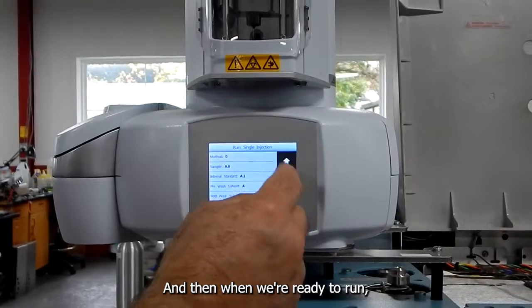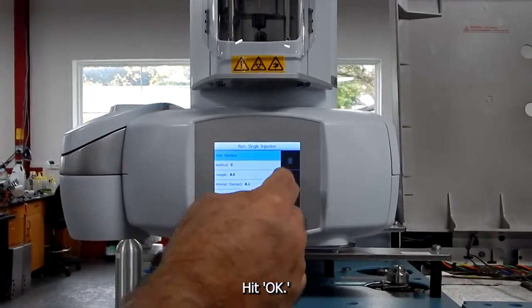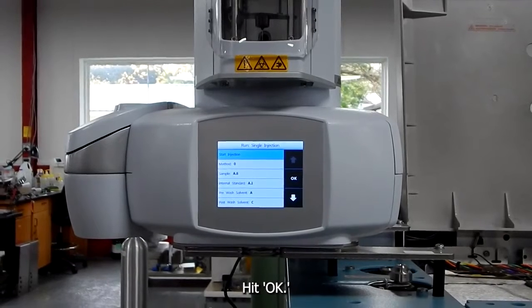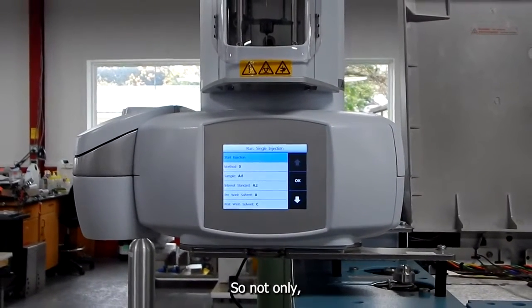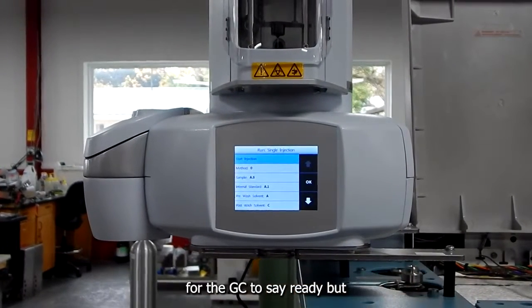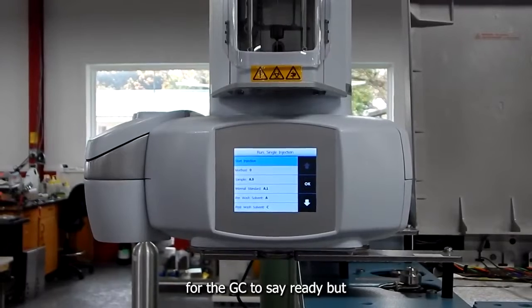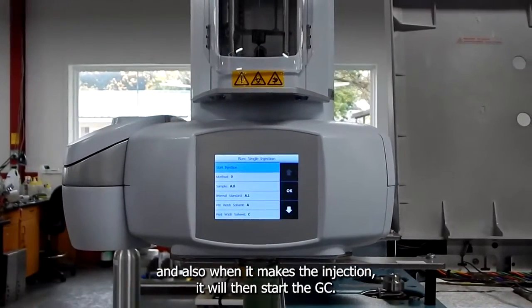And then when we're ready to execute it, we'll hit OK. And this has a double handshake. So not only is this going to wait for the GC to say ready, but also when it makes the injection, it will then start the GC.